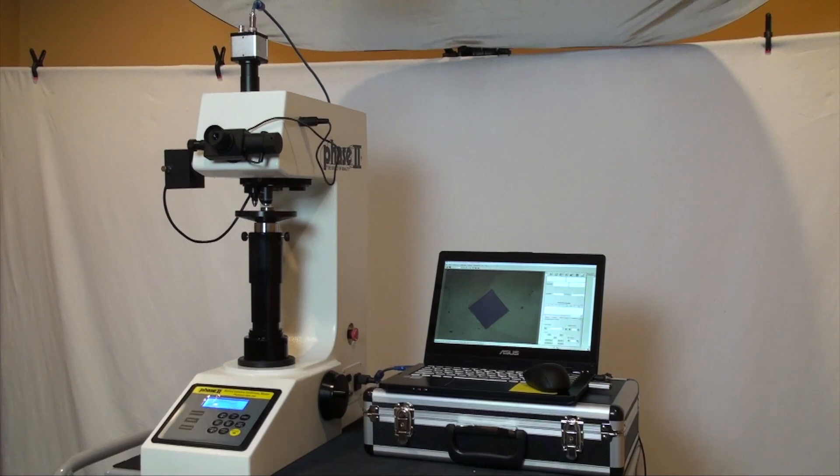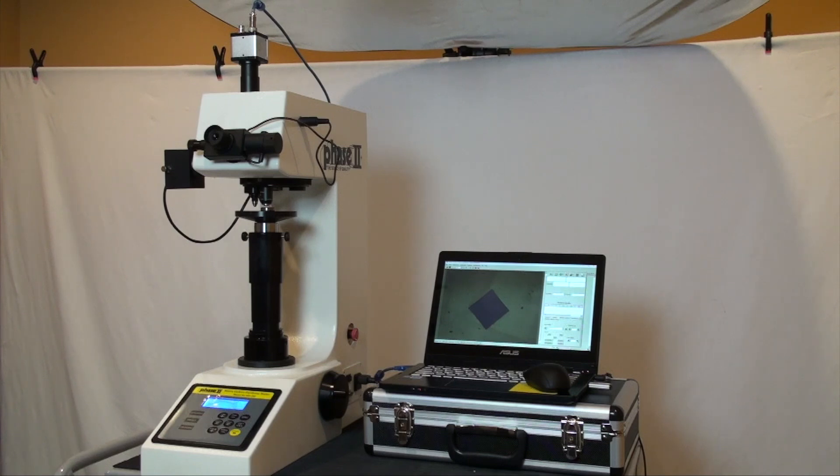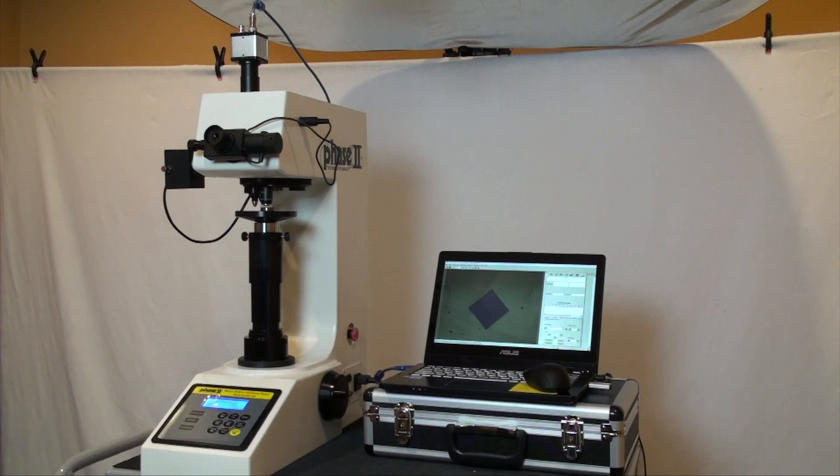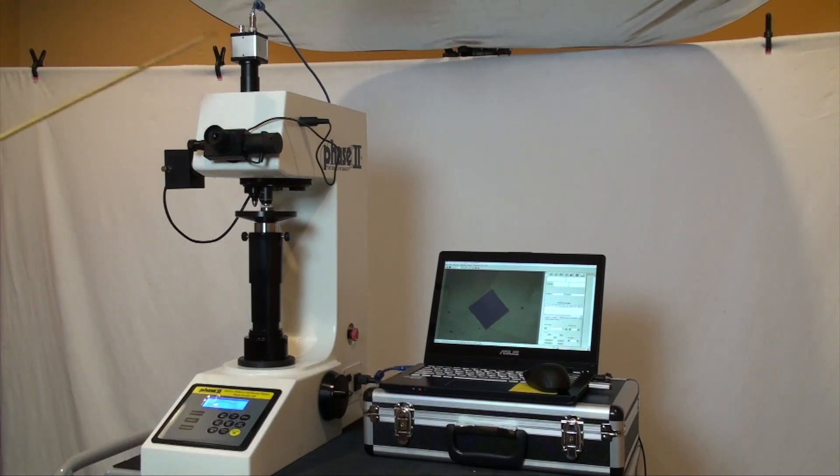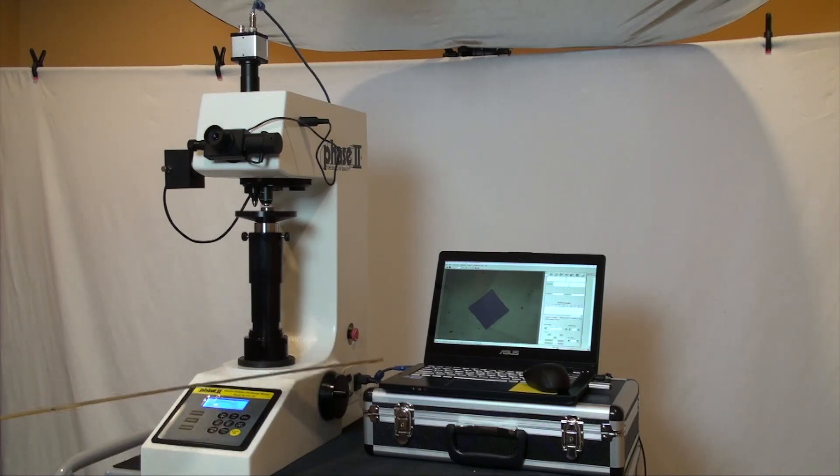Let's begin with the unique design of this series hardness tester. The manual optics system with left and right measuring drum wheels. Though for today's demonstration video we will use the digital optical system you see installed here on top and connected via USB cable to a laptop.